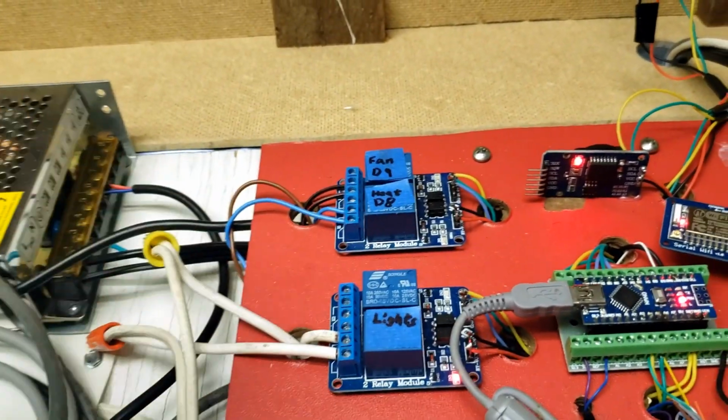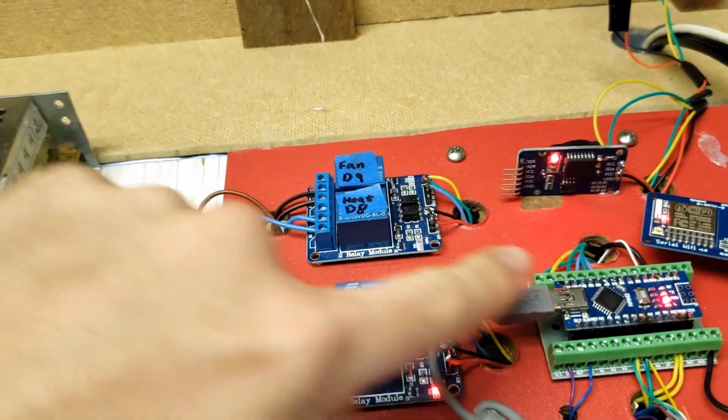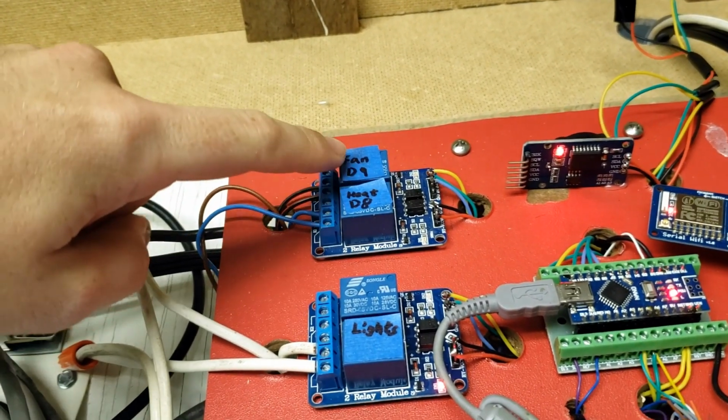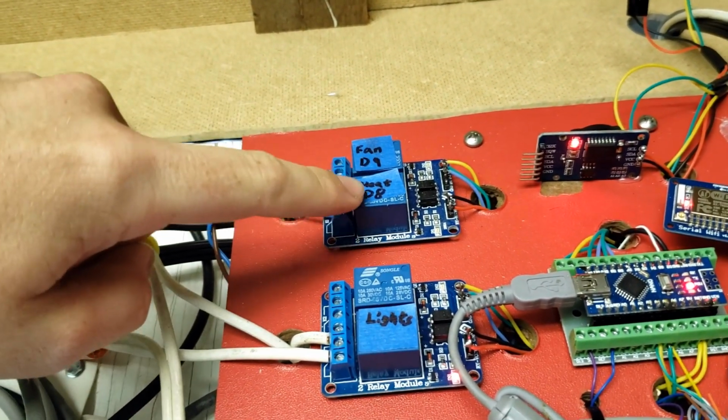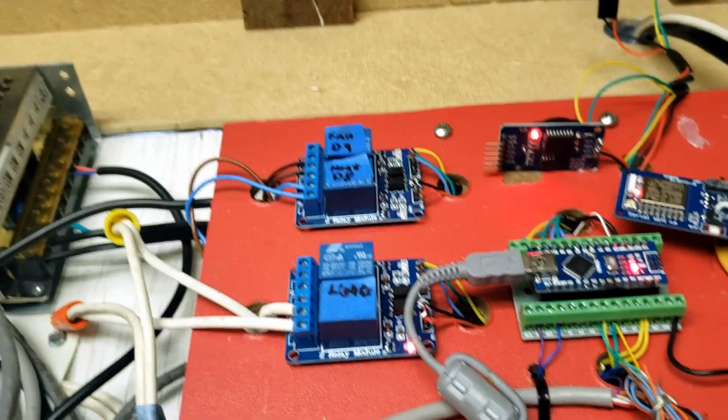And then over here, these are the switches. They're the relays. This Arduino board controls each of these switches. So whenever it senses that the fan needs to turn on, it clicks the fan on. Same thing with the heater here and the lights. And I'll show you a demo of that in just a minute.